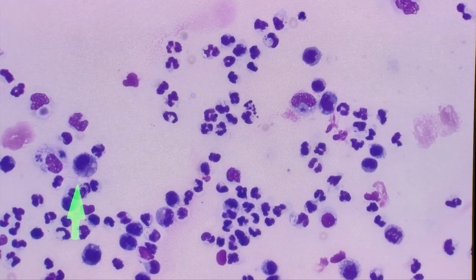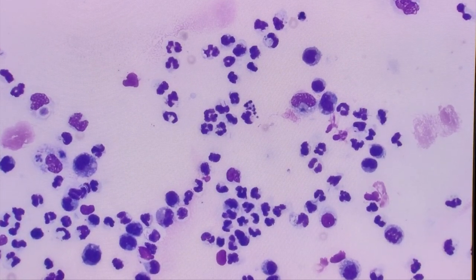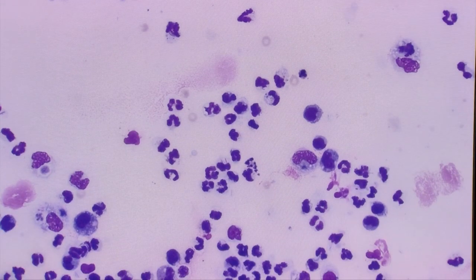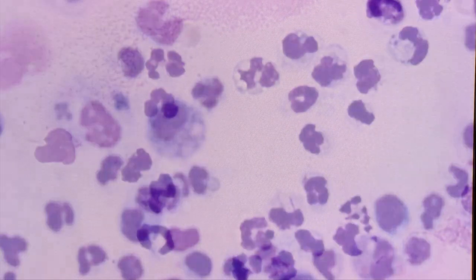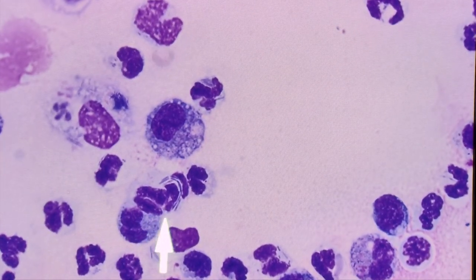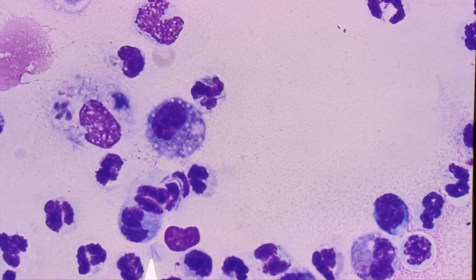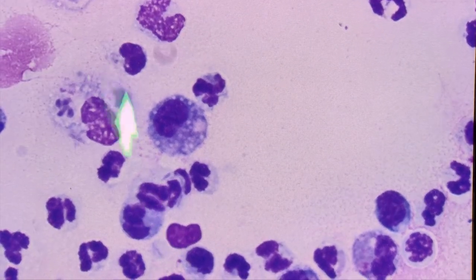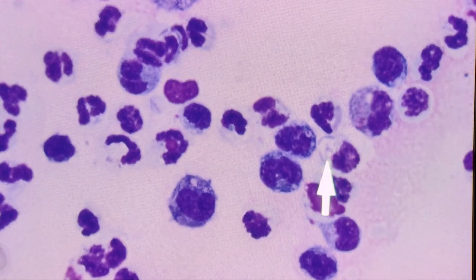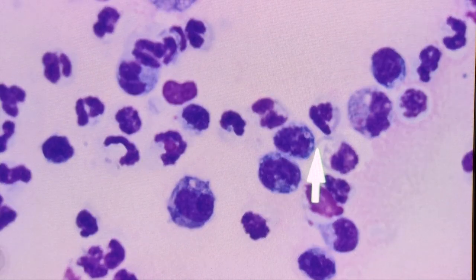You can see bacteria in the cytoplasm there — we'll go to 100x oil now so you can see those a little better. At 100x power, the bacteria show up even better. You can see some nice long slender fine bacterial rods in that cell, and some outside of a cell here, probably from a cell that has actually disintegrated. There's also a variety of lengths of bacterial rods in this particular cell — some shorter rods versus these longer slender rods.